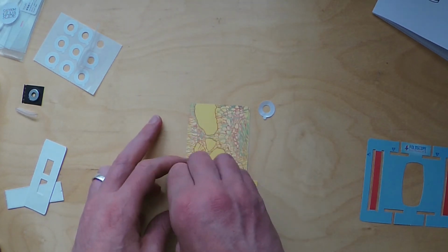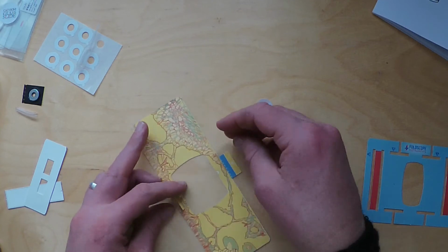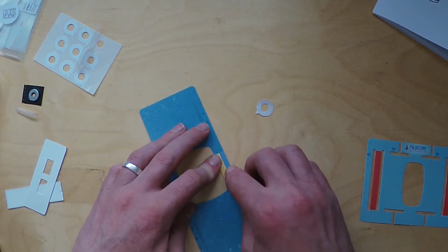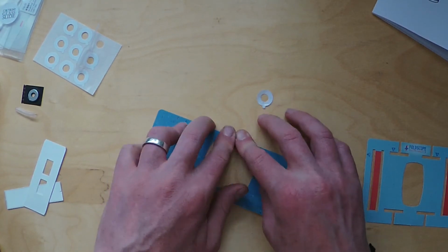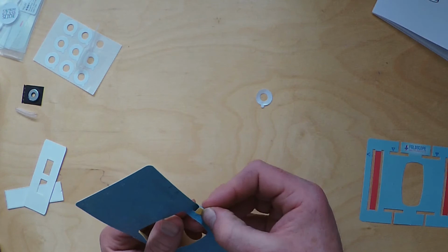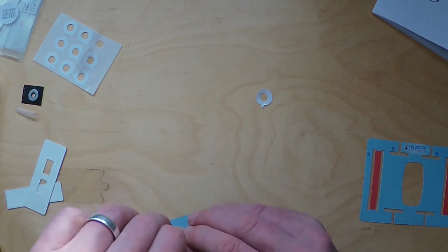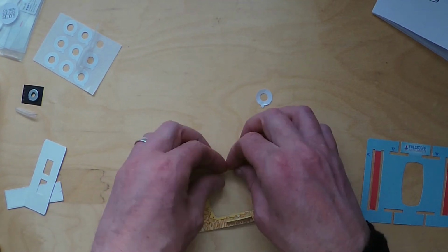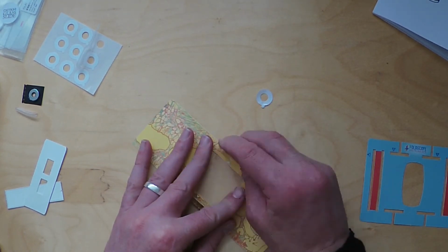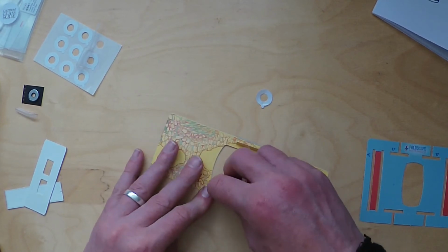Sometimes it's good to flatten it down and use your nail to make sure the fold's quite secure. Do your fold along the perforation first, actually, it's quite a good tip. Like so. And that tucks into that little slot there. Sometimes you need your finger to just encourage it to go in. Then on the other side, fold it back over. Good idea to just use your nail to make that fold quite permanent.